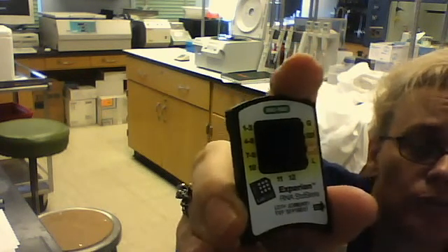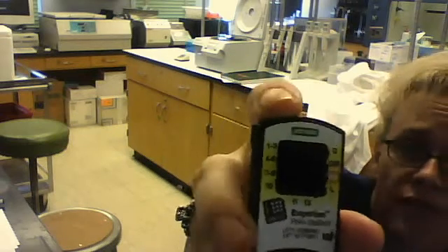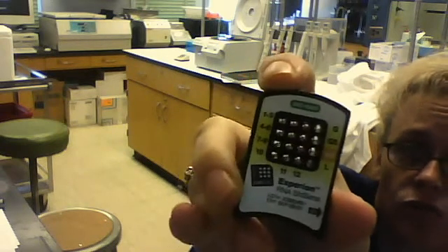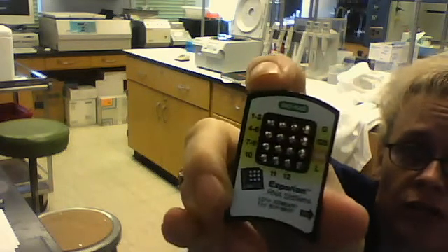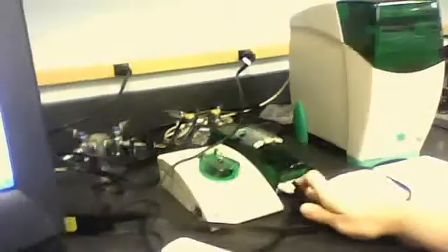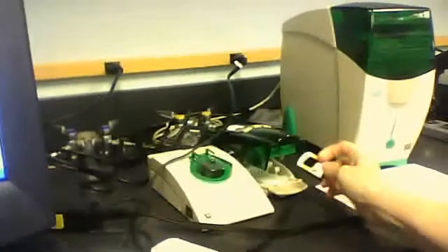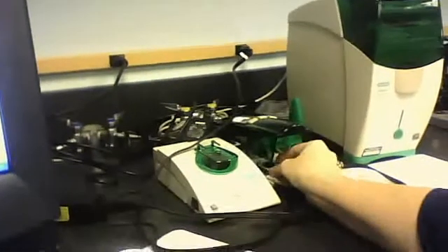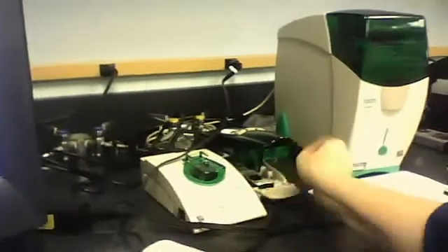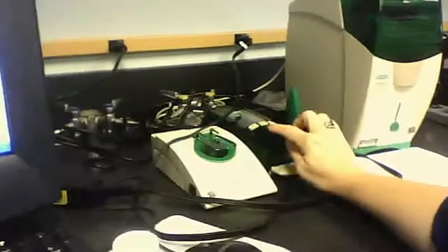And then you want to take a look at it. Make sure there's no bubbles in there inside of the little holes. If you don't see any bubbles, you want to prime the chip. And this is your priming unit. You want to make sure that the settings are on 1 and B, and then you hit start. And then it will take 30 seconds and your chip should be primed after that.